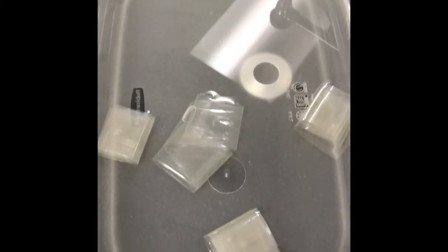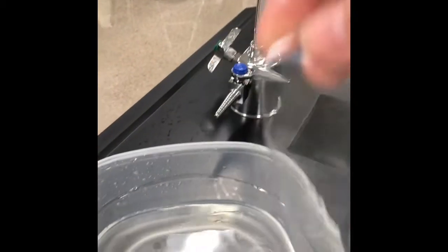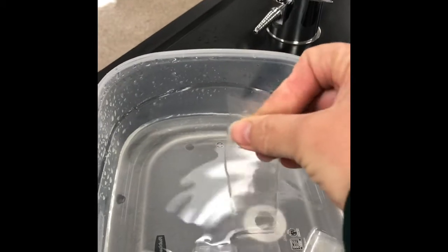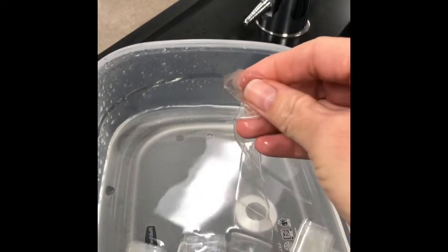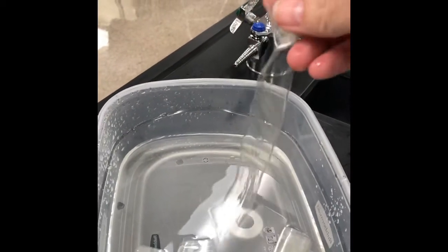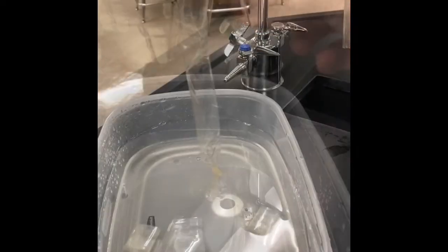Okay, so this is what it looks like when you put dialysis tubing in distilled water. I've already washed my hands, by the way, so my hands are clean. And this is dialysis tubing. When you soak it, it's really kind of pliable. So what you have to do is like this with the hand. You can see like this. You have to kind of move it, get an opening in it. Once we have an opening, then we know that we can put some solutions in there. But first what I have to do is tie a knot in one end. So I'm going to do that.